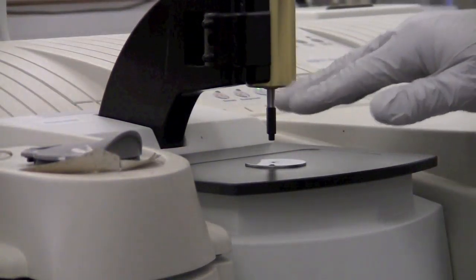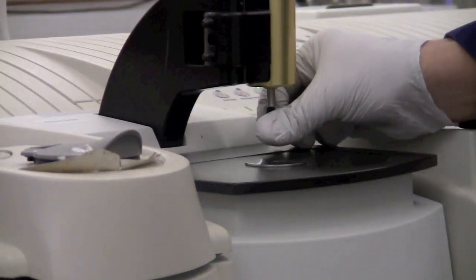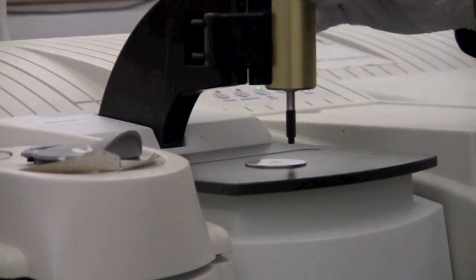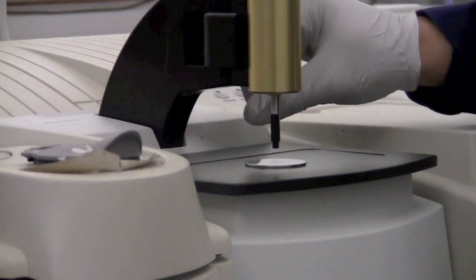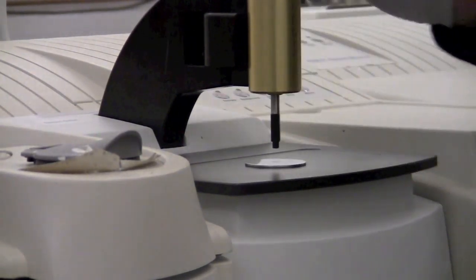If it's solid, we need to use the anvil to press the sample down into good contact with the diamond. For a powder, you should use this black tip, which is designed for powders. There are other tips available attached over on the side here for different types of samples, but typically we're going to use the powder tip.